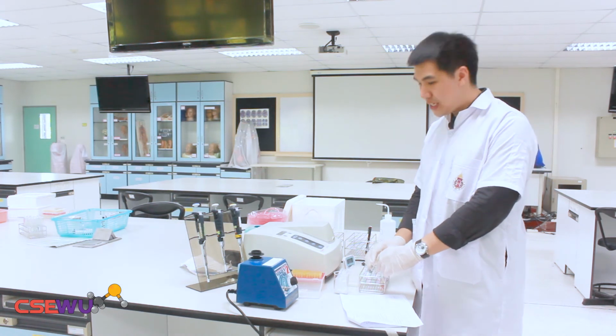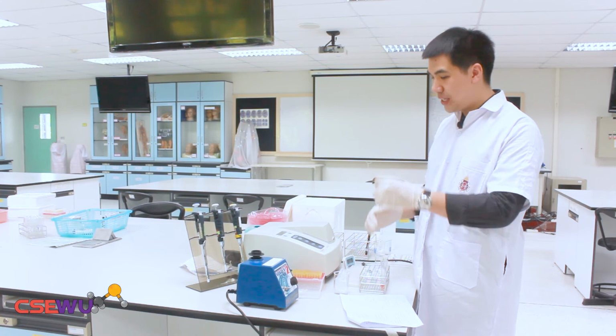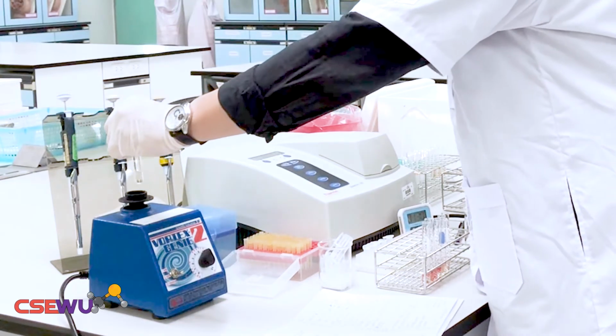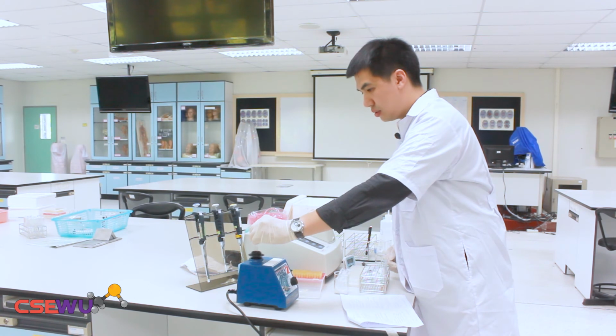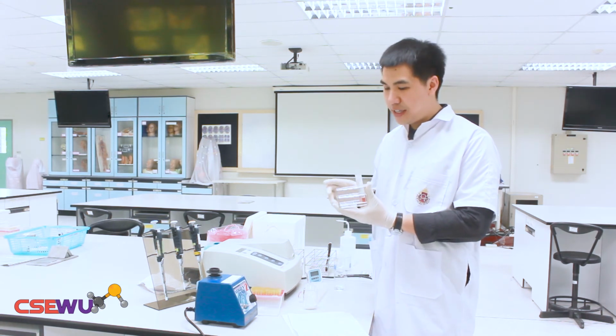Now you have finished adding all the sample solution, 10 microliters, into the 6 tubes here. So you just mix them together by vortexing. Okay, after we mixed the solution together, we left the solution for 10 minutes.